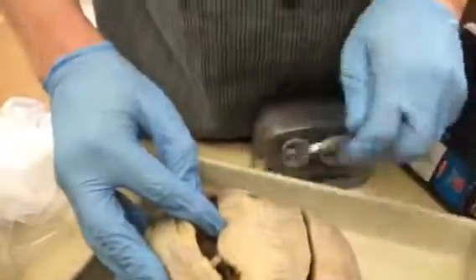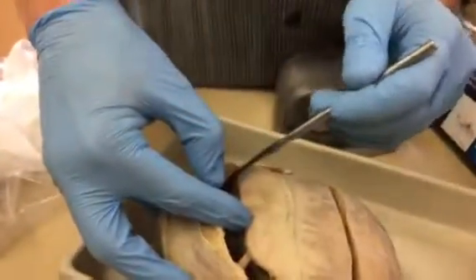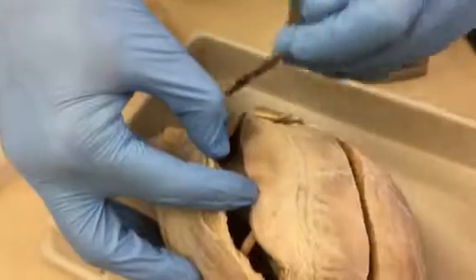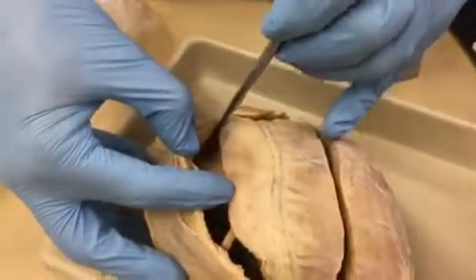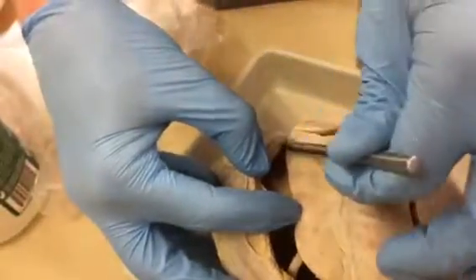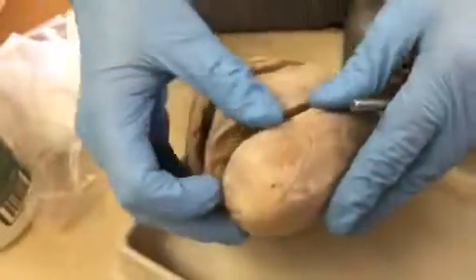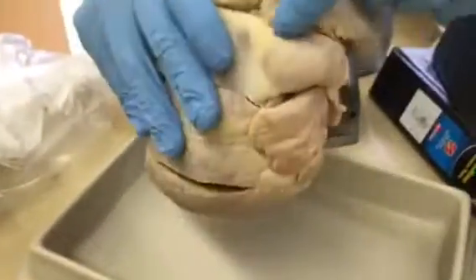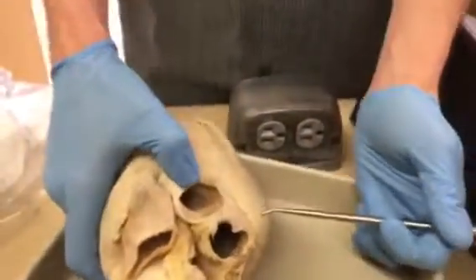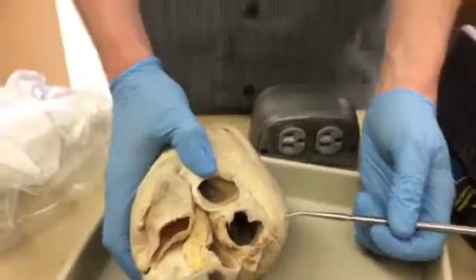So this one is for the pulmonary semilunar because this is the pulmonary trunk right here, and you can kind of see there's a flap right there and a flap right there. It's a little hard to see, but I would have to pin like right there. And then for the aorta one, it's even harder because it's so deeply buried underneath this aorta. But it's there. It's just hard for me to get at and hard for you to see. Okay? So that's the aortic semilunar.